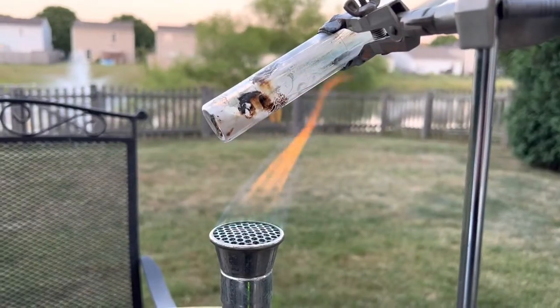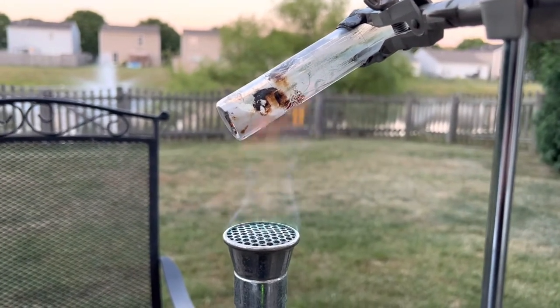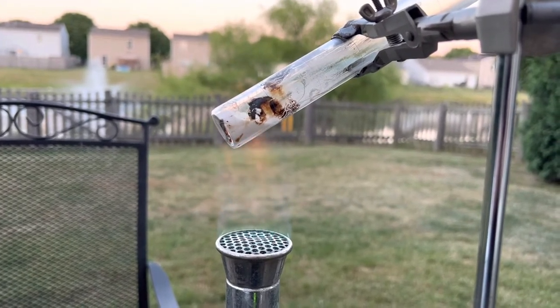At this point, you're ready to turn on your Bunsen burner. As it heats up and decomposes, you'll start to hear a popping sound. That's the lead nitrate decomposing into lead oxide, nitrogen dioxide, and oxygen gas.